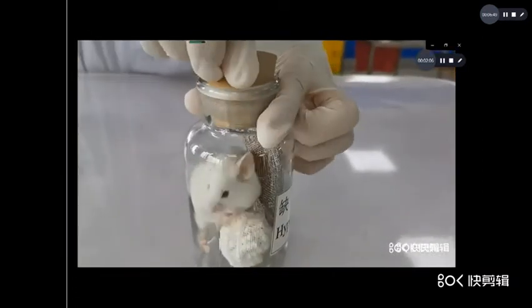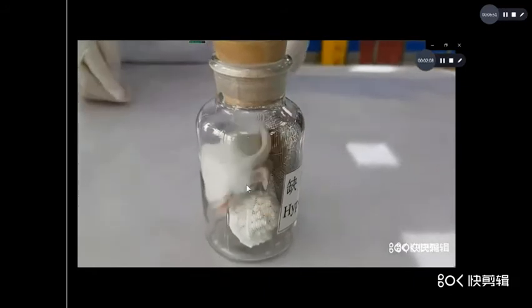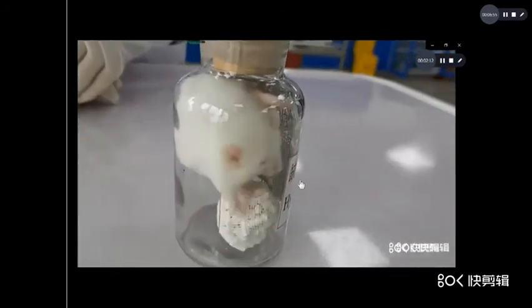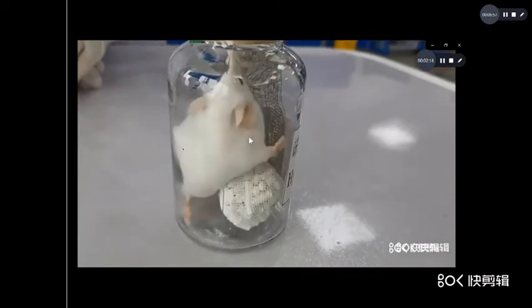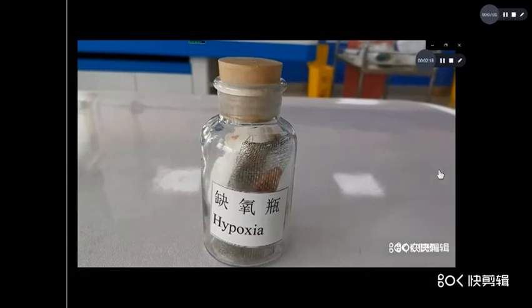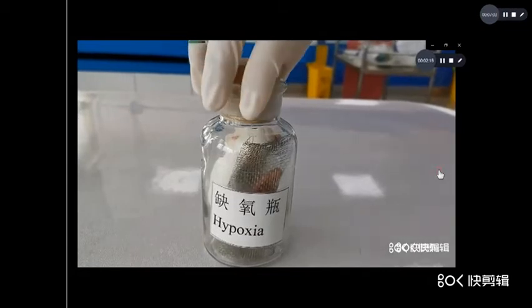Now cover the jar, so the animal's inspired oxygen will decrease, so the animal has hypotonic hypoxia. Now you observe the respiration and the color of skin.